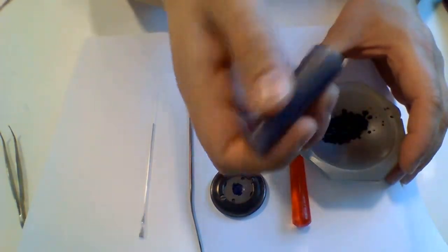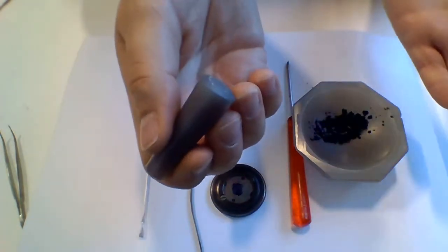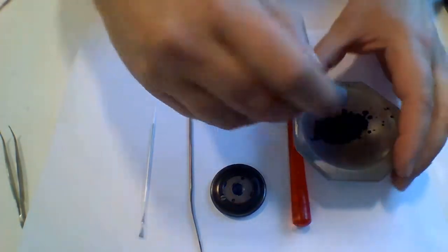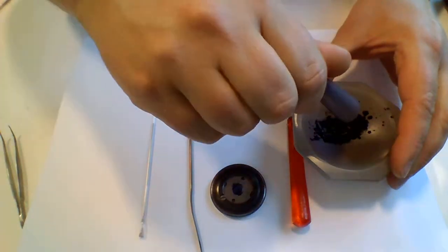No hammering like this. This is not the proper way, and you can break the tool. You should just, by rotation, grind your sample.